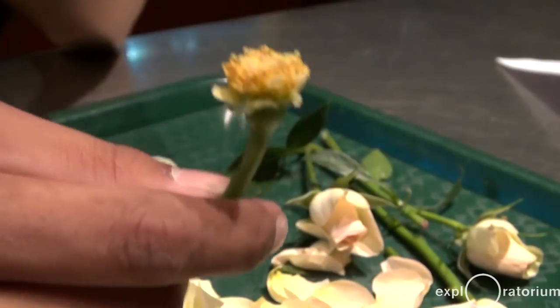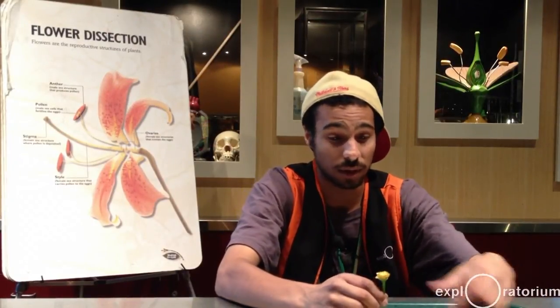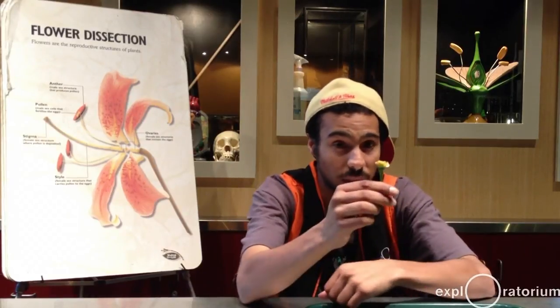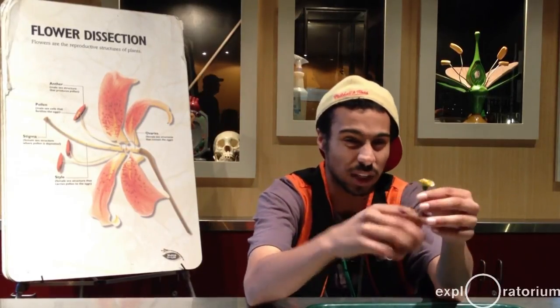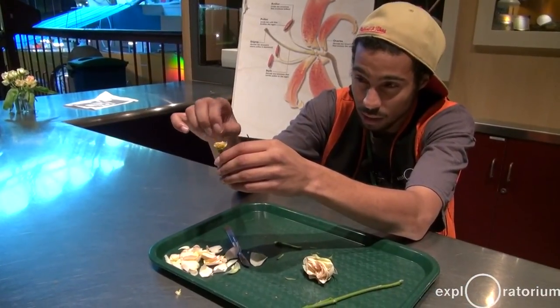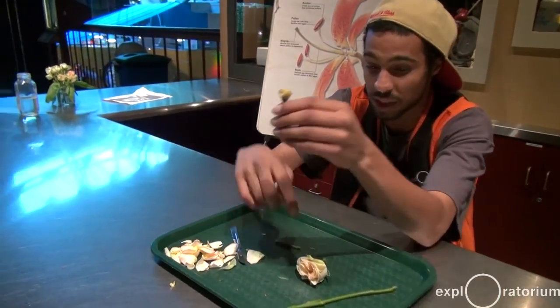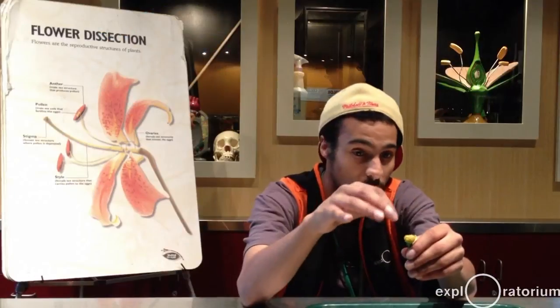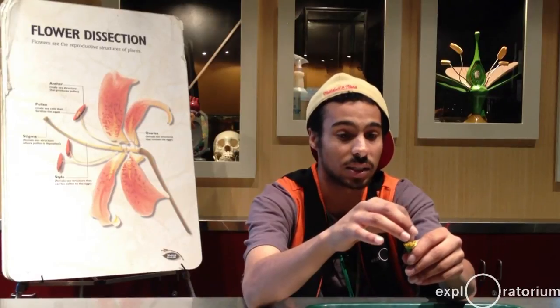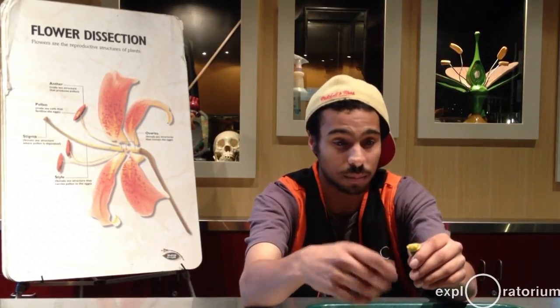So what happens is that when a bumblebee is flying from one flower to a different flower and crawling around inside the flower, it has these really fuzzy little legs that are like Velcro, and they get stuck to the anthers. The anthers rub pollen onto its little legs, and then when it flies to the next flower, it walks around and gets pollen stuck right into the stigma. The stigma's sticky little hairs catch the pollen.